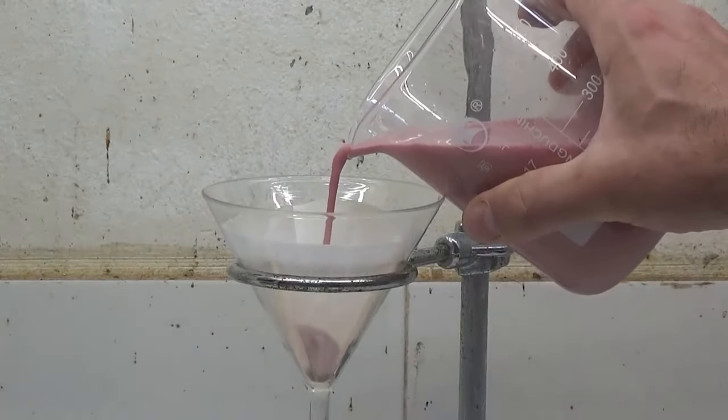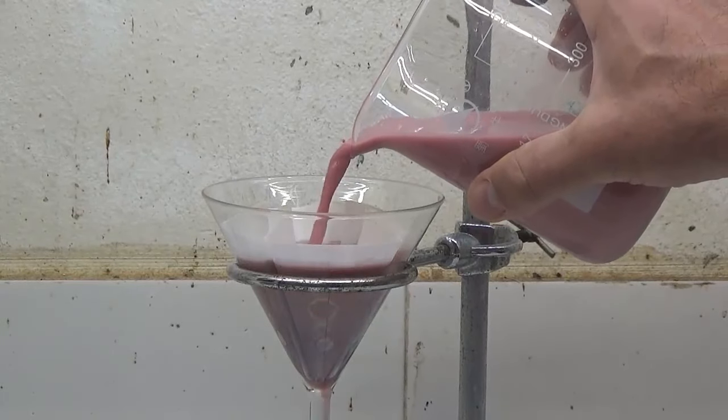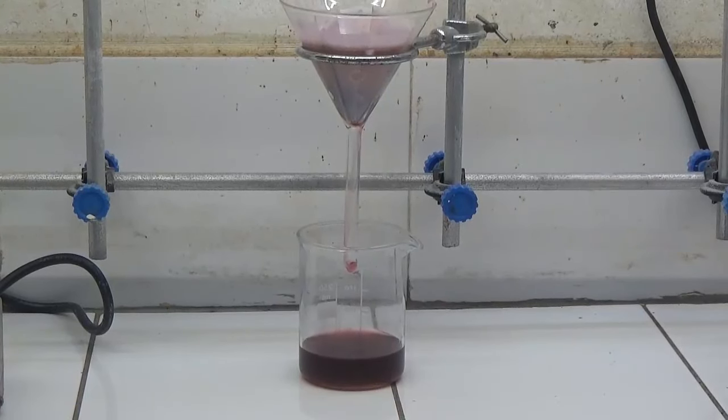Separation of insoluble barium sulfate by filtration. The cobalt thiocyanate solution is concentrated by evaporation in half its volume.